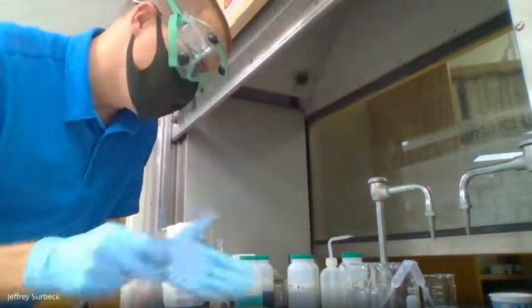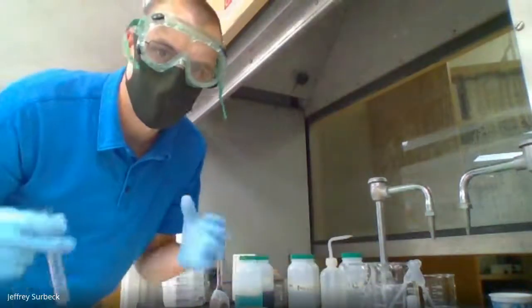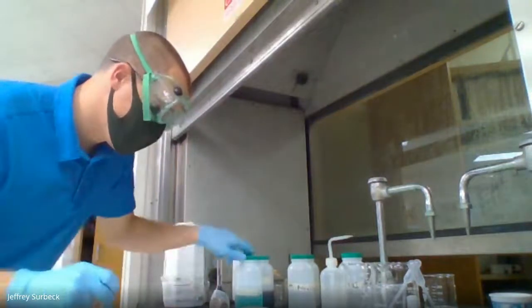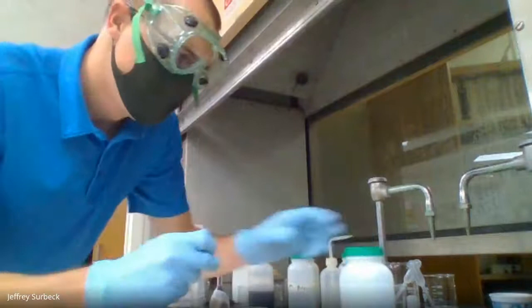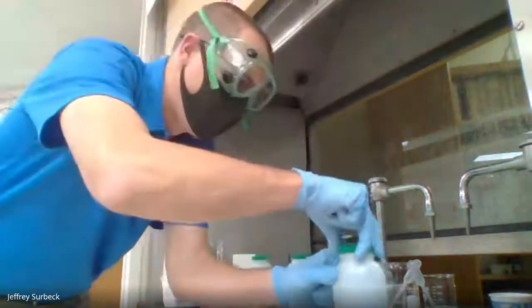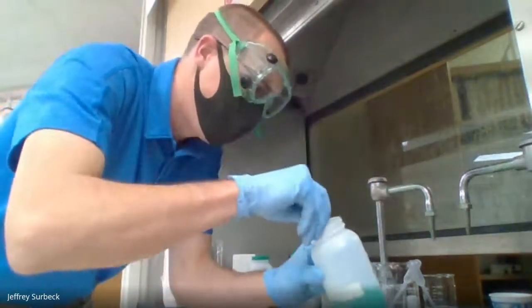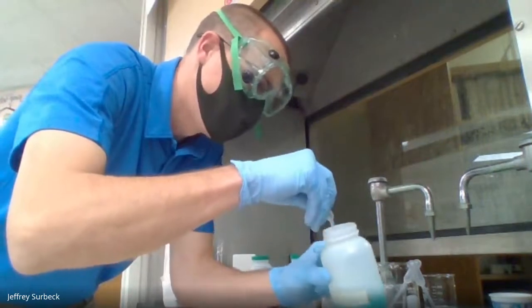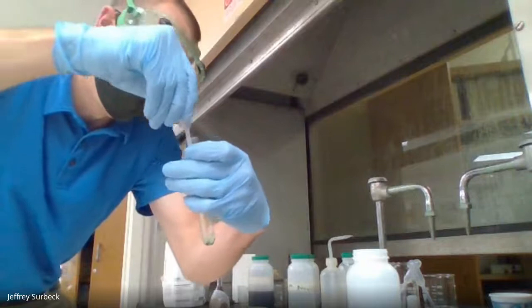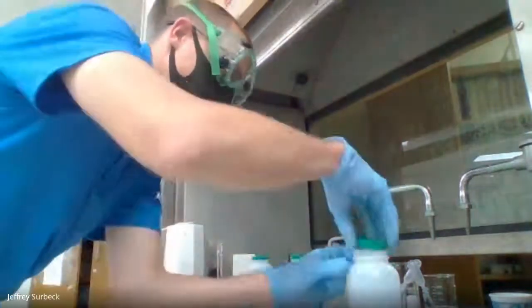And I'm going to do the exact same procedure, except instead of starting with copper(II) sulfate, I am going to start with nickel(II) chloride. So nickel(II) chloride, same concentration, 0.1 molar, in case you're wondering. And I'm going to add a milliliter of our nickel(II) chloride. Okay, so nickel(II) chloride's going in the test tube, and I added about a milliliter of it.